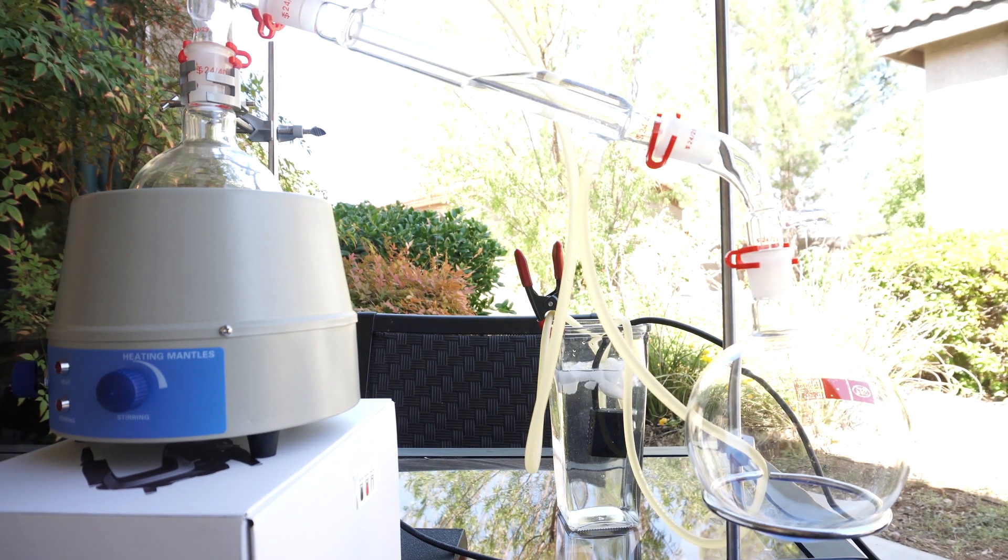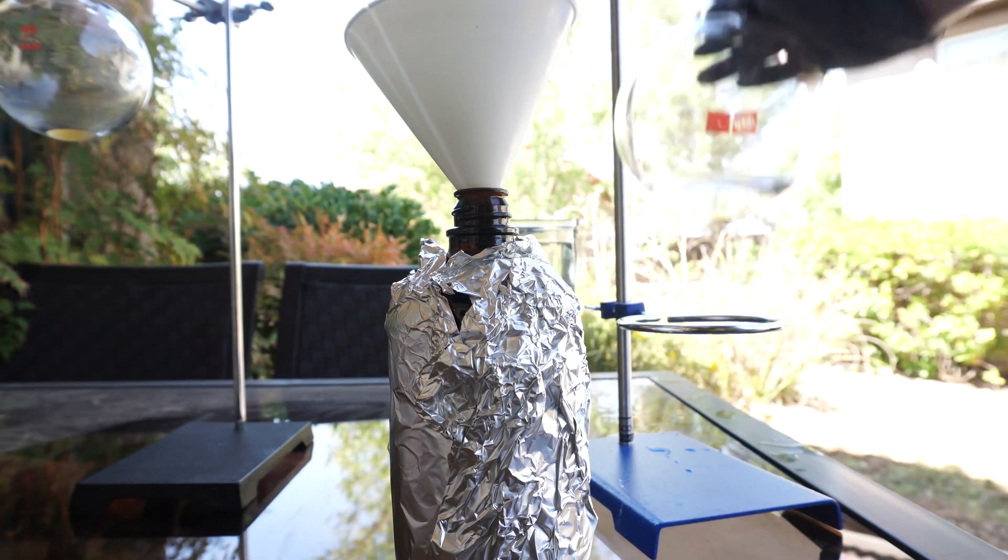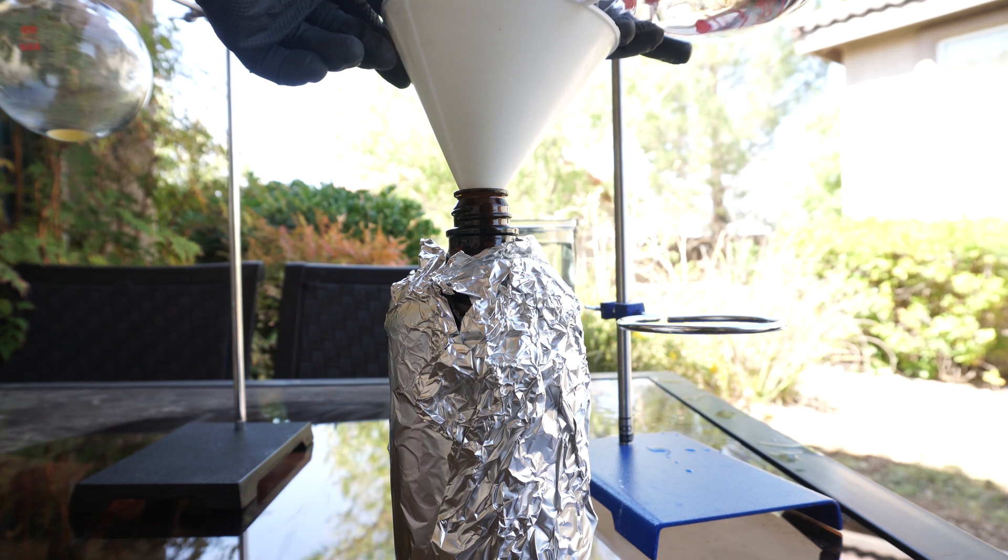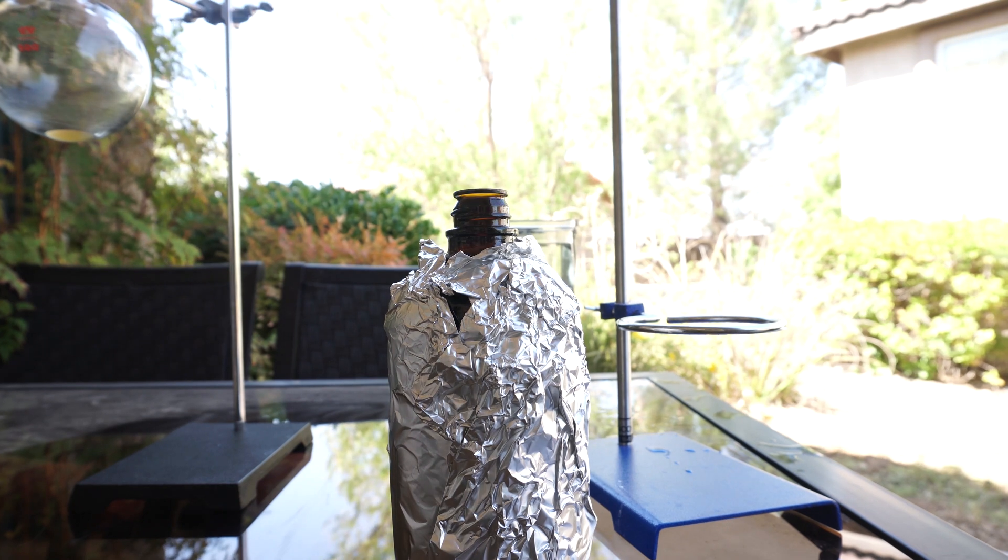As I said earlier, I recovered about 149 milliliters out of the 150 milliliters I used, and the other milliliter was probably still sitting in my distillation set somewhere.